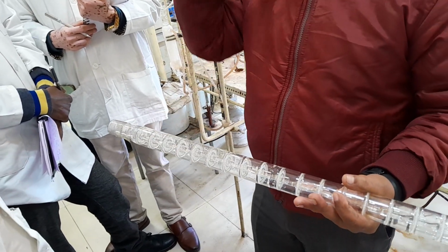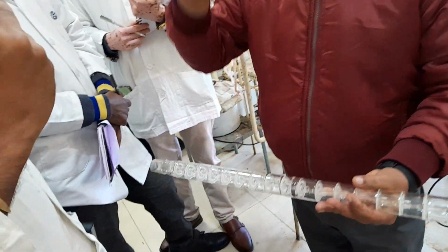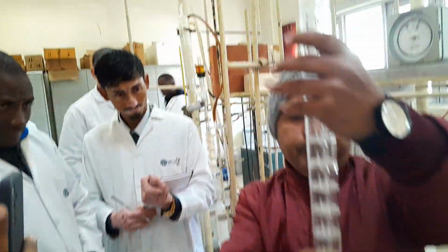Once there is an equilibrium of 20 degrees centigrade between two plates, obviously the compounds with boiling point 30, 35, 40 degrees will definitely settle down. So how that goes back, now I will show you.